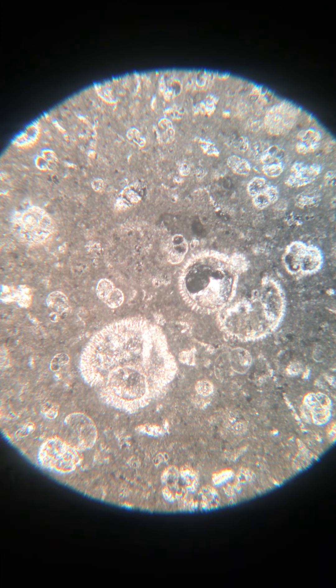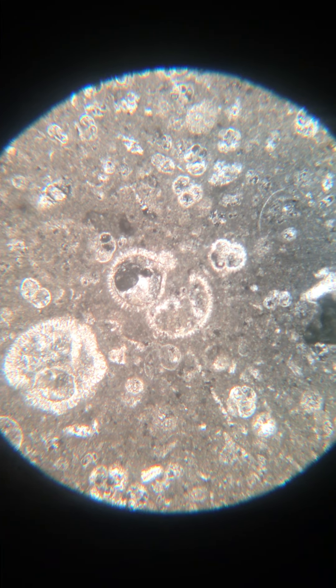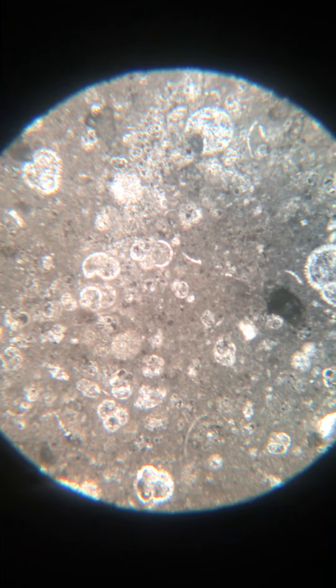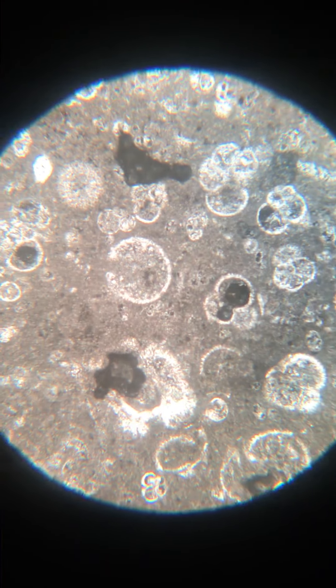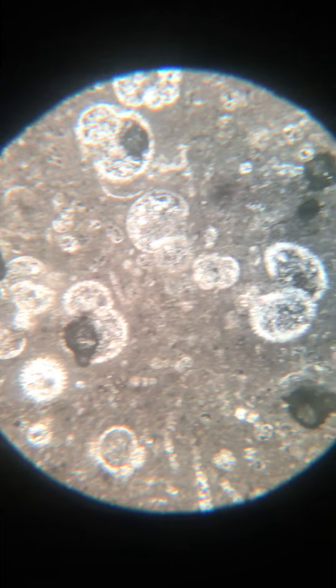This is a micrite — a micritic rock with a lot of planktonic foraminifera inside. You can see them from their very thin chambered tests, which look like little coils in a micritic backdrop. I have taken a lot of photos of these already, so I'm just making a video now for reference.